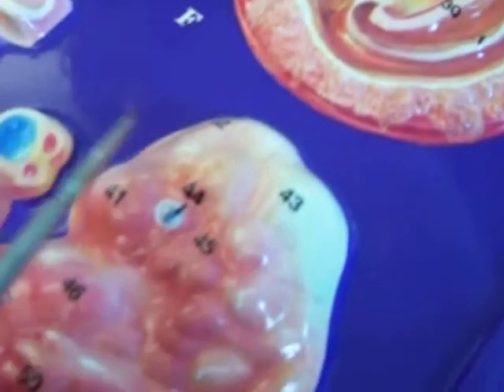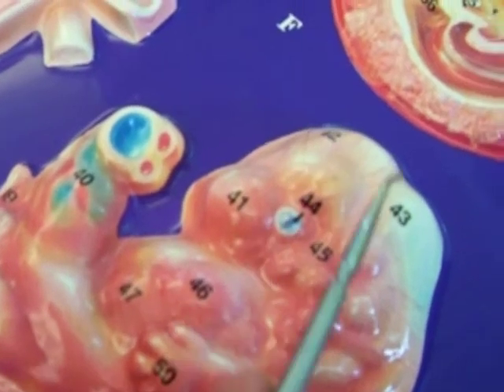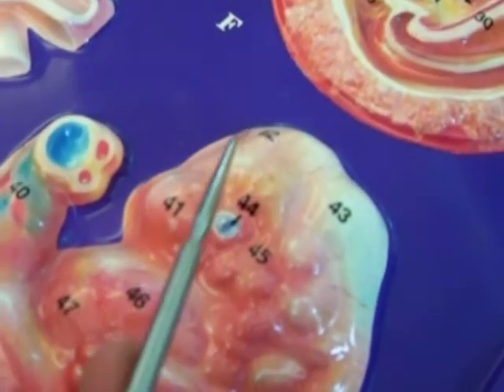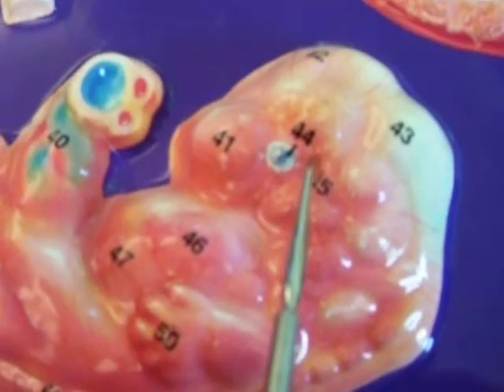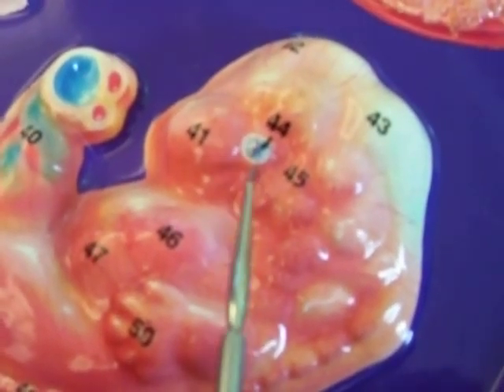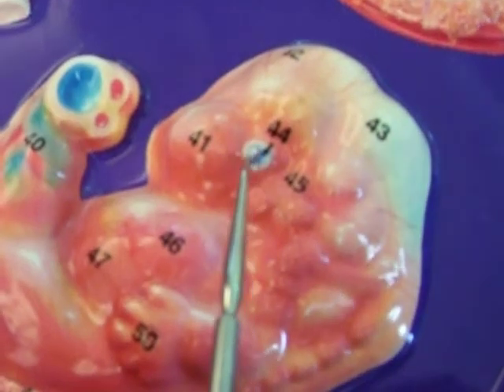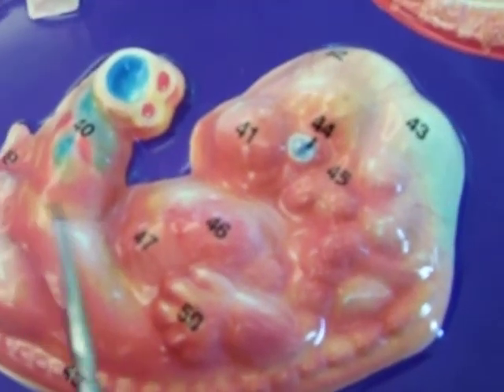You can see right here, in terms of the embryo developing, you have the individual primary brain vesicles. You can see these 3. You can see the optic cup with the actual lens placode. So the optic cup is everything, with the lens placode, maybe the bluish structure here.